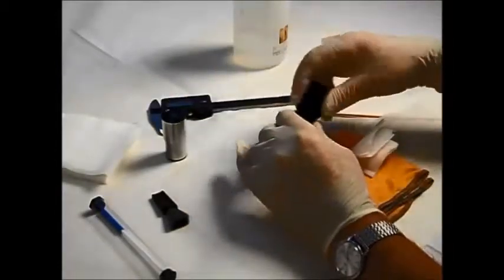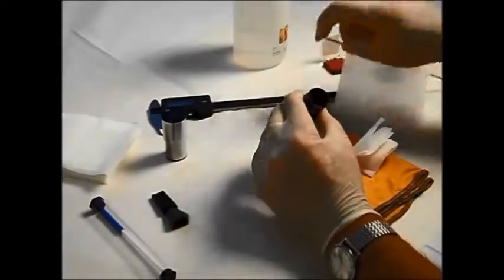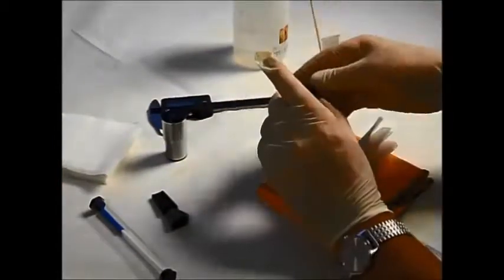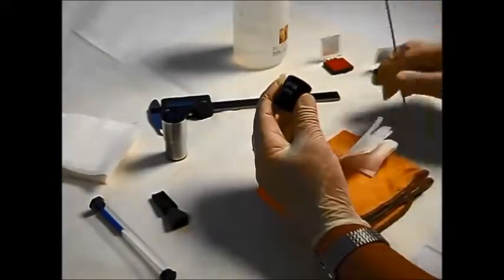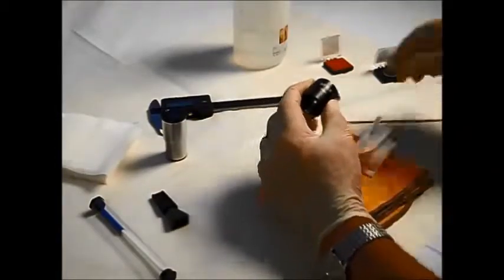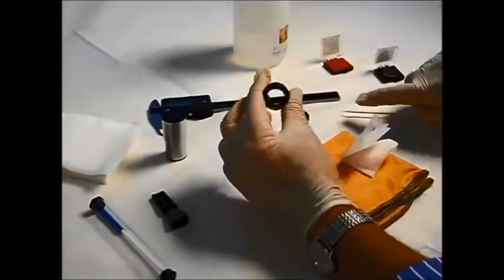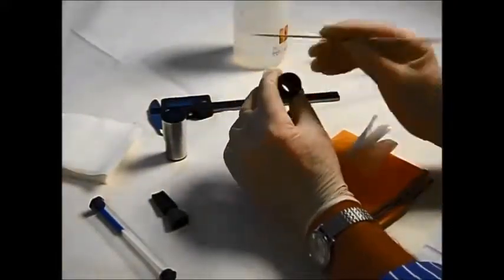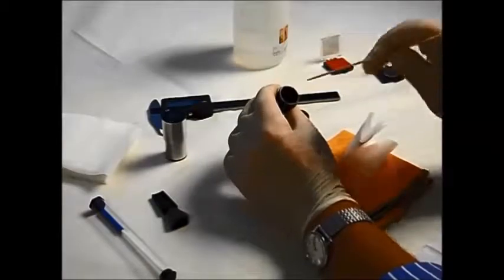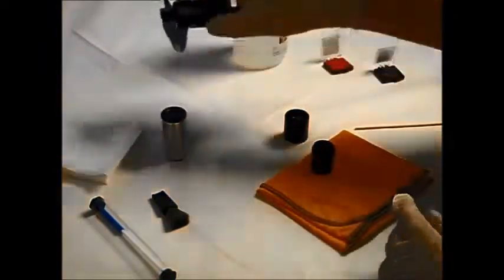Now, this is a Ramsden one, and you saw me open this one earlier. In this case, we're looking at an open tube here, and the lenses are in this piece here. You can see the lenses here. So this is the eyepiece lens, and there is the field lens about here, and the reticle is actually held in this open tube. Now it's a little bit like the diagram you saw earlier. As you can see, there is a shelf here which holds the reticle itself, and that is what we need to measure now to get the dimension for the reticle to fit this one.